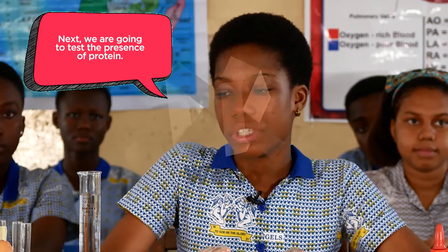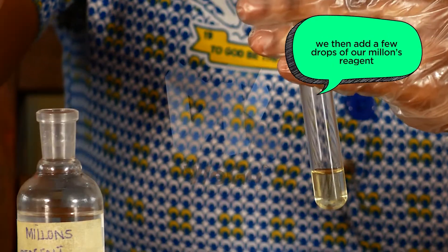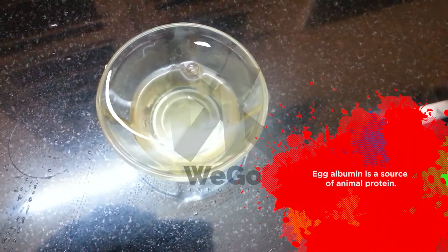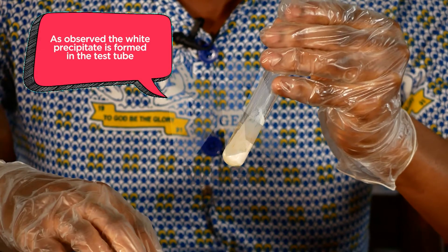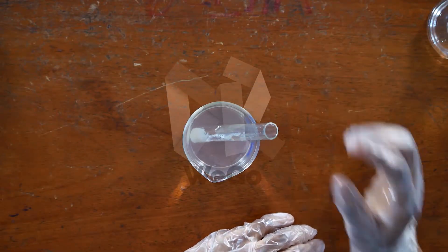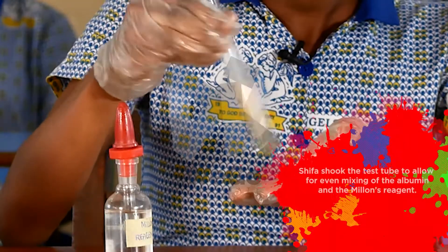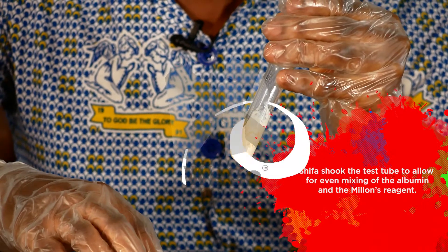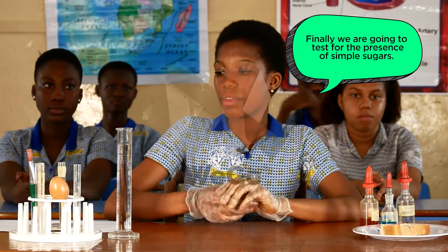Next, we are going to test for the presence of protein. We pour a little of the egg albumin into the test tube, then add a few drops of Millon's Reagent. Egg albumin is the source of animal protein. You then shake the test tube. As observed, a white precipitate is formed and should be left in hot water. Shifa shook the test tube to allow for even mixing of the albumin and the Millon's Reagent. After a while, traces of red are indicated in the precipitate.